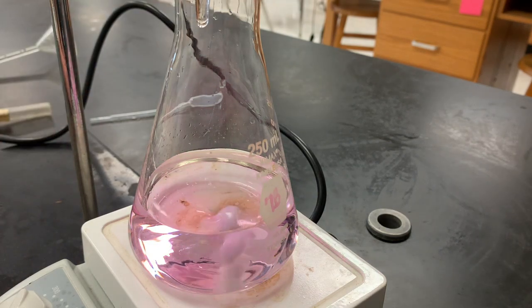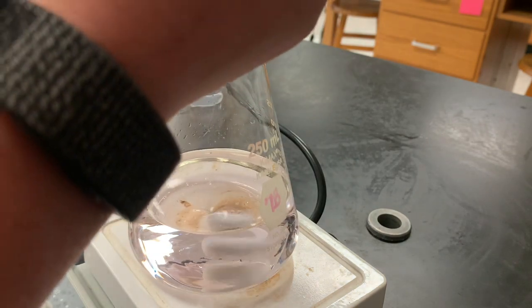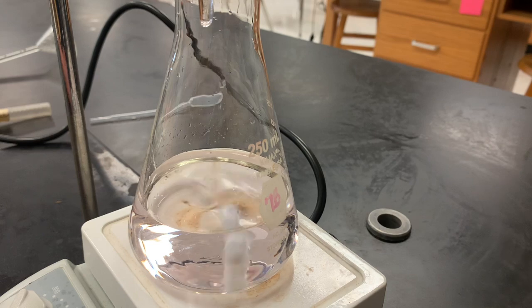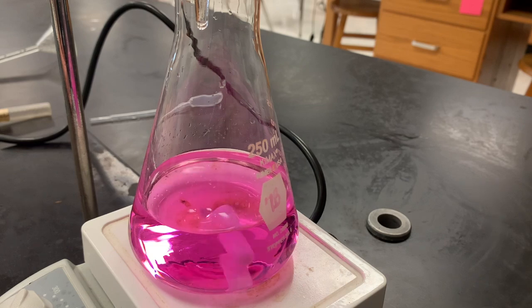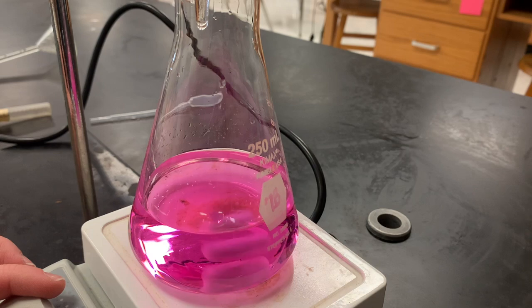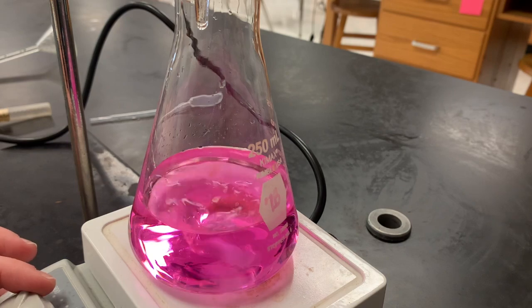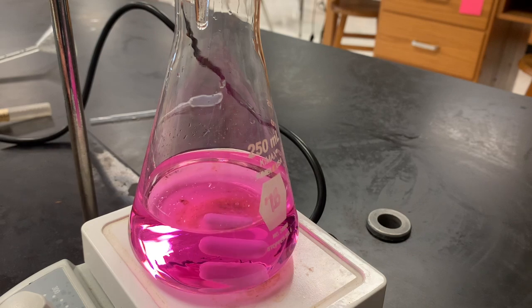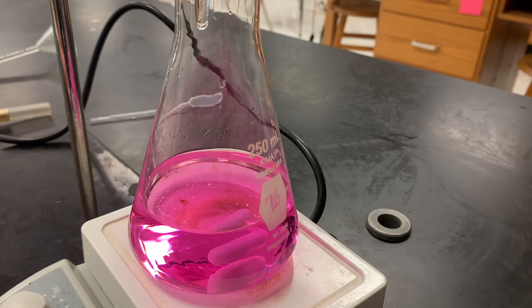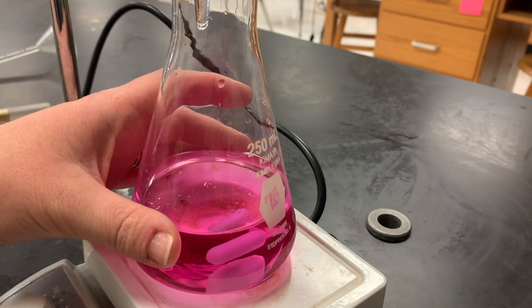Okay, it's getting close. It disappeared again — it did not stay for a minute — so now we're doing one drop at a time. There's two drops; I might have done too many. We are past our titration point by a drop. You can see how quickly that happened.